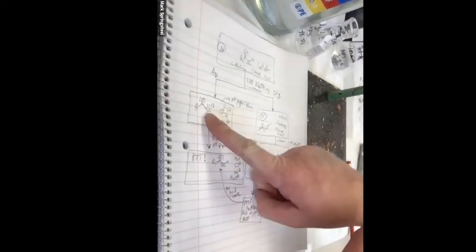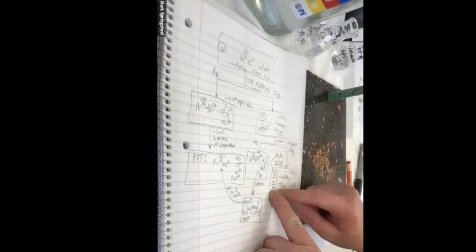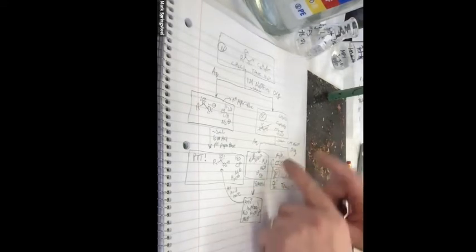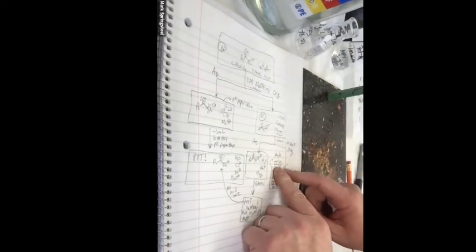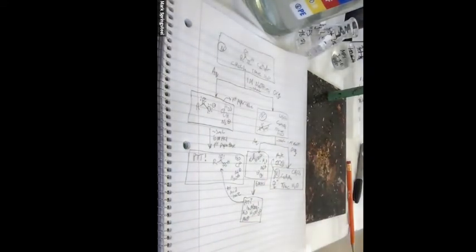I don't think so, because it's likely you would have done that already. Yeah, because for the acid-base step, we need either a carboxylic acid or a carboxylate or an amine or an ammonium. But this one has no carboxylic acid, no carboxylate, no amine, no ammonium. I cannot separate these with acid-base chemistry. So how am I going to get them separated?